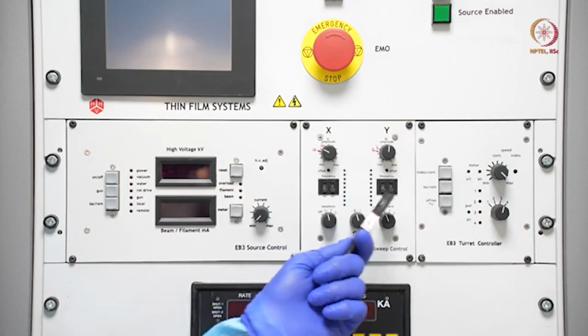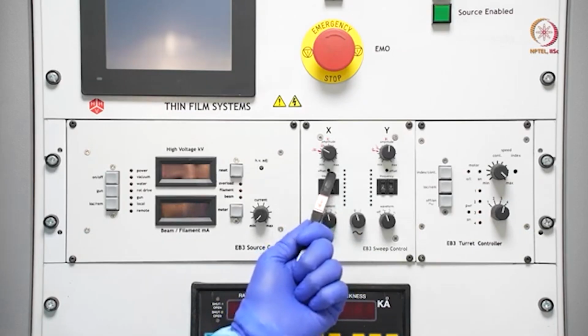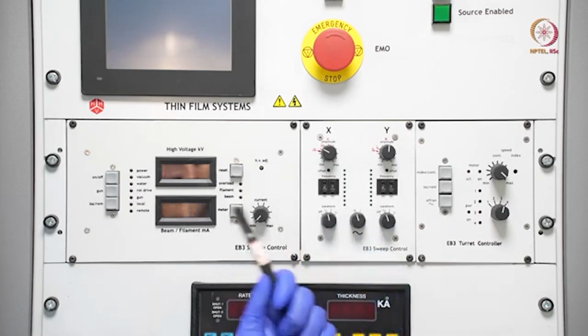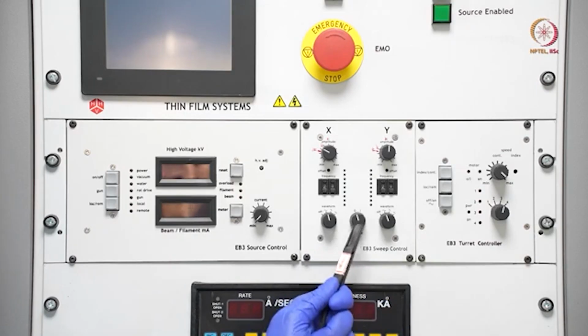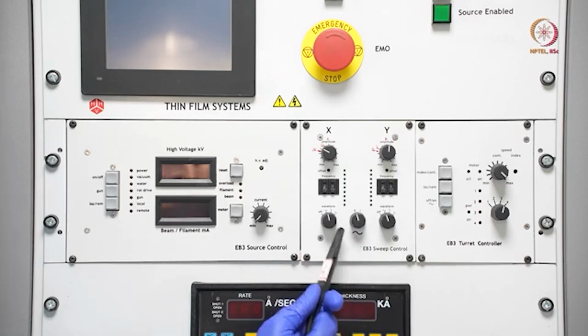Here, as you can see, we have set both frequencies at 29 Hz, and there is some offset like the HV adjustment. Once it is set, the offset need not be changed for any of the depositions. Only if we want a point source, then you can leave it as 0, so that this part will be off and it will generate a point beam from the source, and it will fall on the crucible.